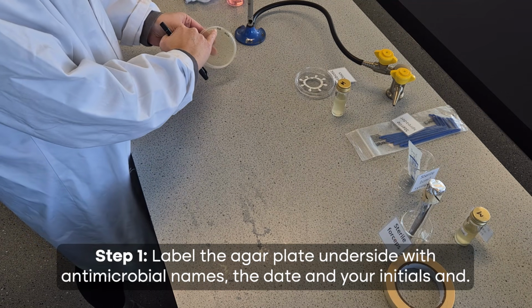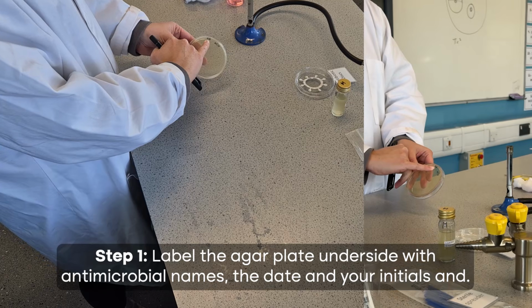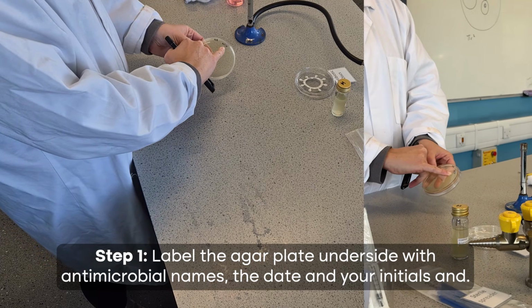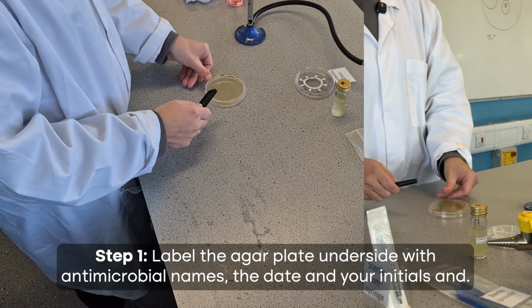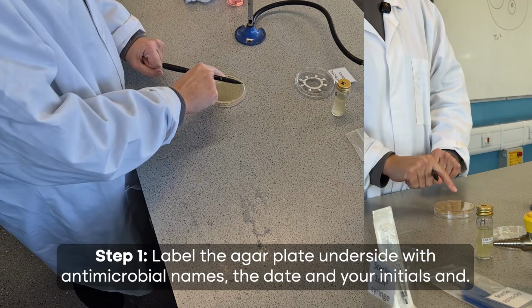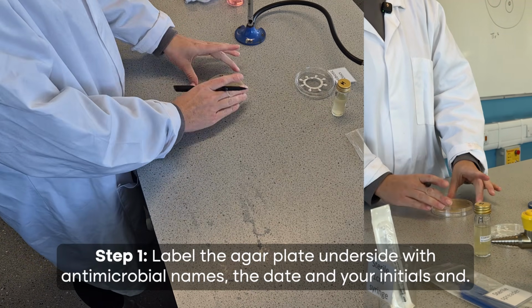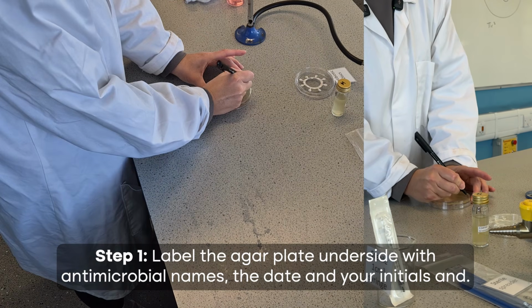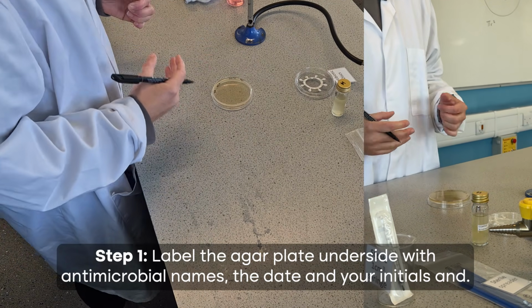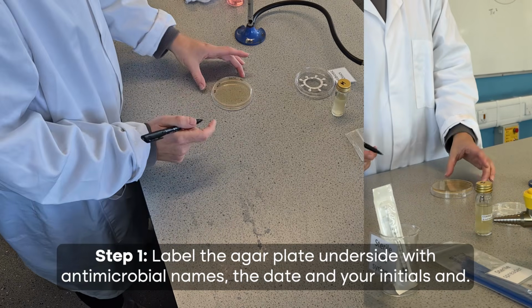So at the moment, it's just saying it contains only nutrient agar, and that was created on this date. Because I'm now going to be adding in something else, you have to add in what is going into the plate, and we do it around the edge so it's not going to block our results at the end. I'm going to put my initials as well, so the students should put their initials because in the class they need to be able to identify which are theirs.